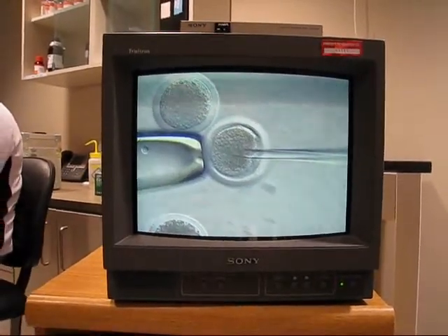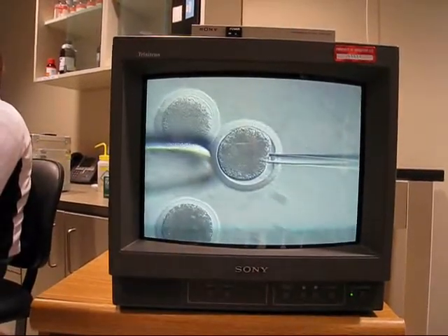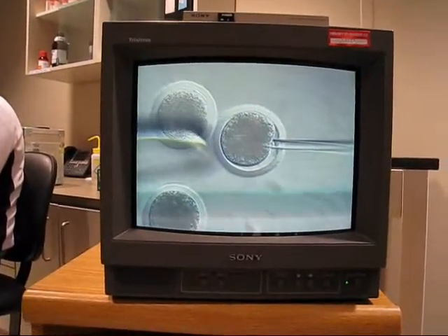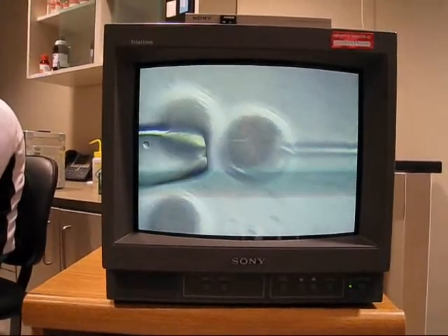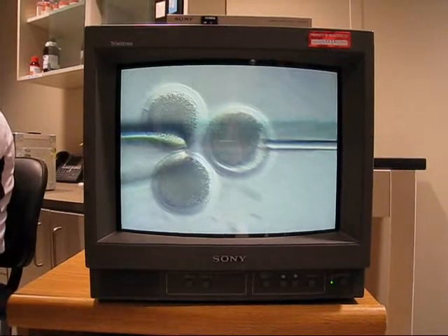Yeah. Really lame duck. Yeah. There we go, I can see it. Okay, hold on here. Look. Ooh, we lost the suction. Okay.